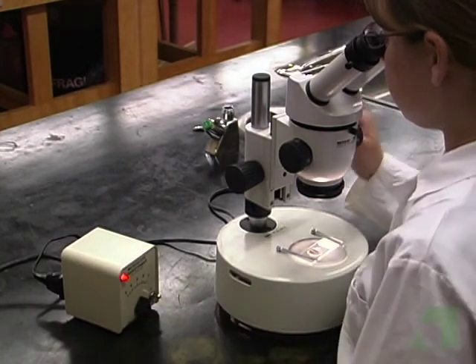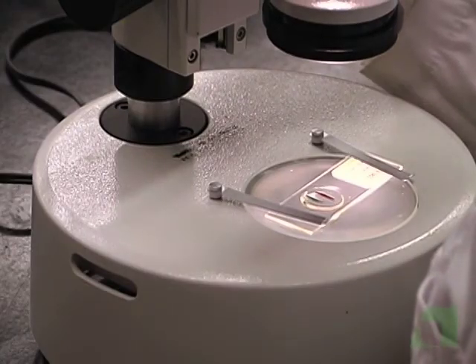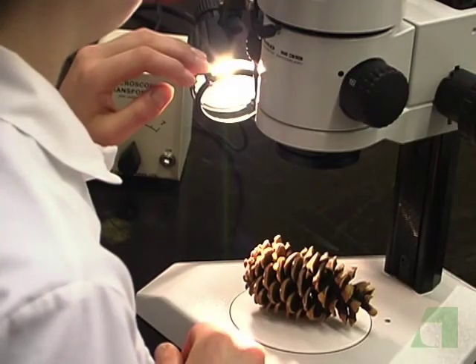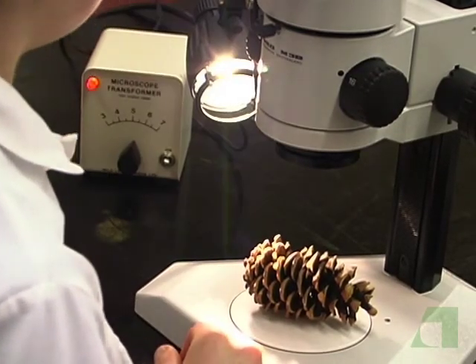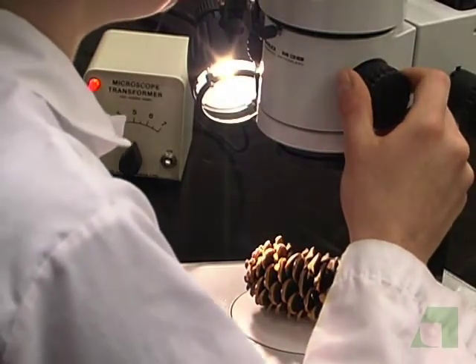Although it's difficult to hurt your eyes with reflected light, be more careful with transmitted light. Too much light can be painful or even damaging to your eyes. Also, the heat from lamps can burn you. Be careful when putting your hands anywhere near a microscope lamp.